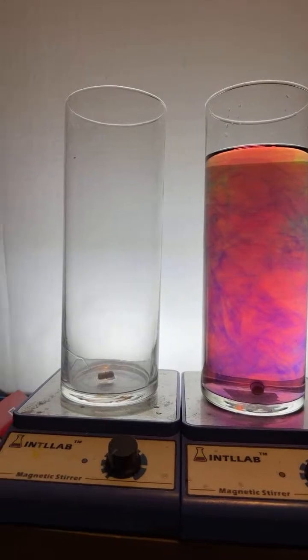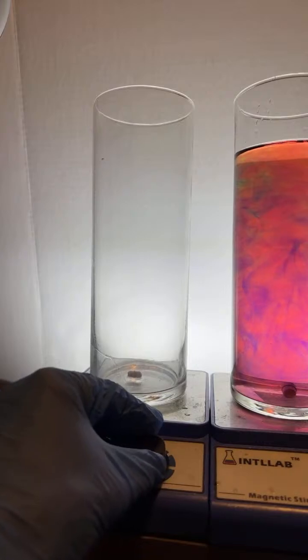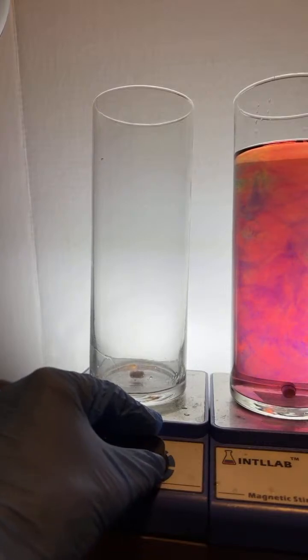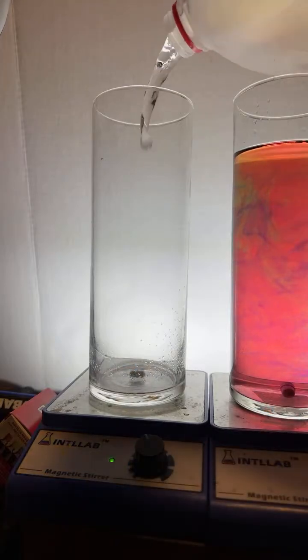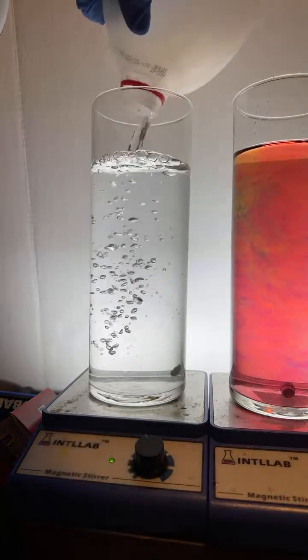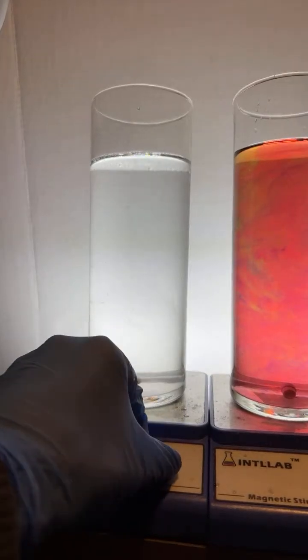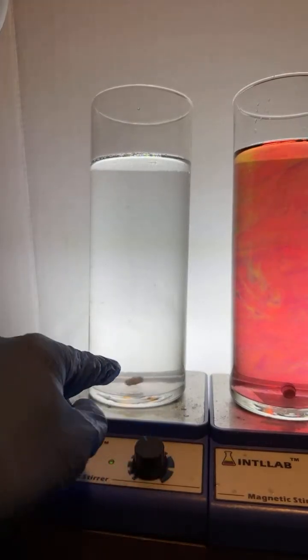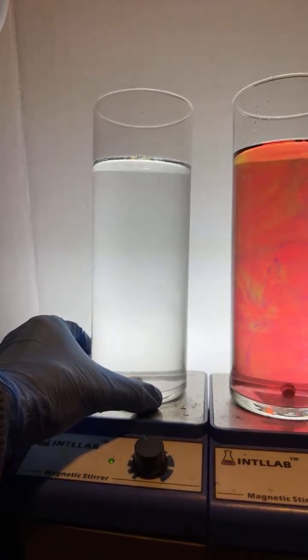Okay, so here we go. We're going to show you how this starts. All right, I'm going to turn on the stir bar. There you go, so we've got the stir bar going. And then we're going to add to this some water. So just get it going in there. Oh, looks like I knocked the stir bar out of orbit. Let me get that stir bar going again. Turn her off. Get her going. Notice that's a really small stir bar there. It's a tiny one. There we go.